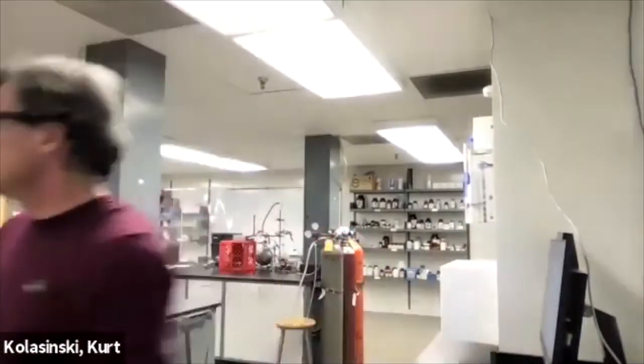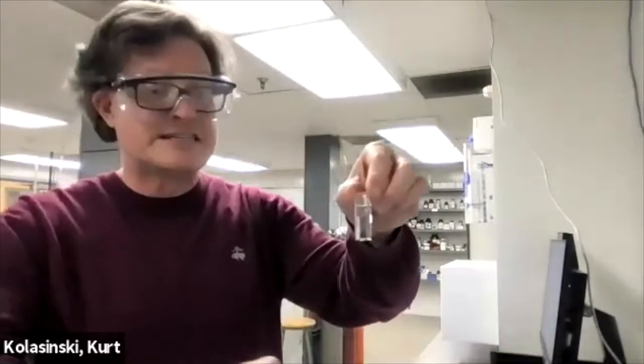And then the only other thing we have to worry about is the zero. What's the zero? The zero is not a solution that contains fluorescein. It contains everything else. So we're going to use KOH plus KI as the background, the blank.